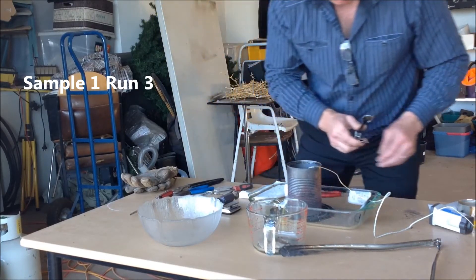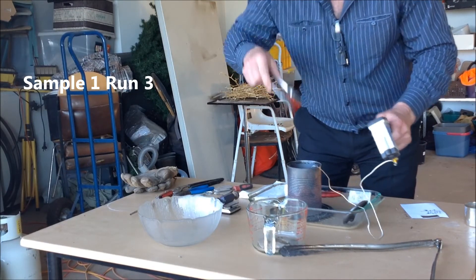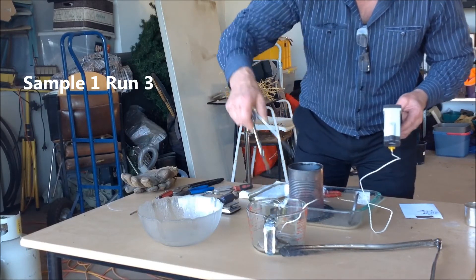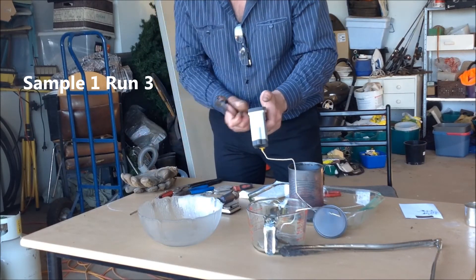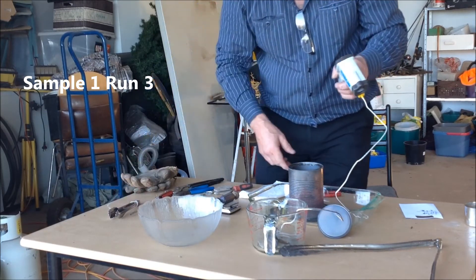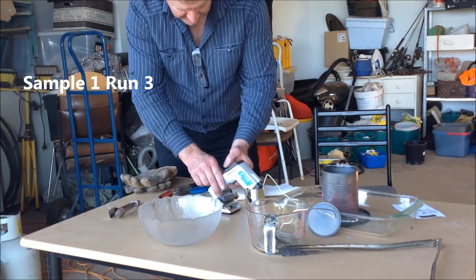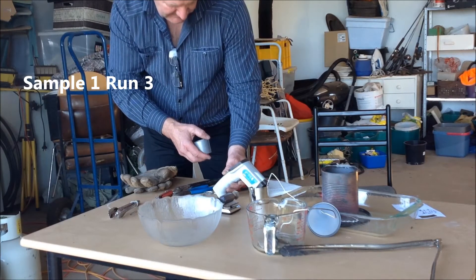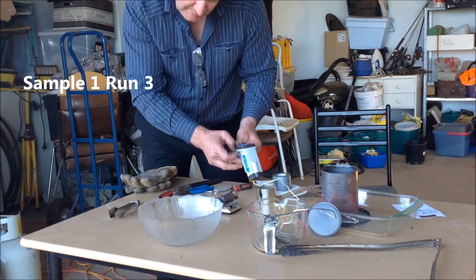267.63 — first reading. Still over 550 in here. 267.62, still over 550 in there. 267.65. 267.61. 510, 267.61. 490, 267.58.